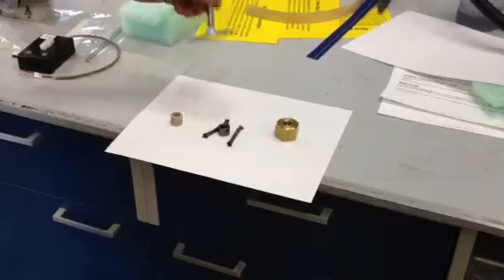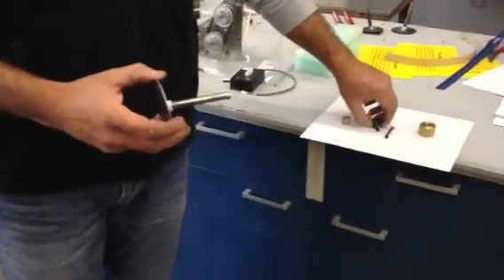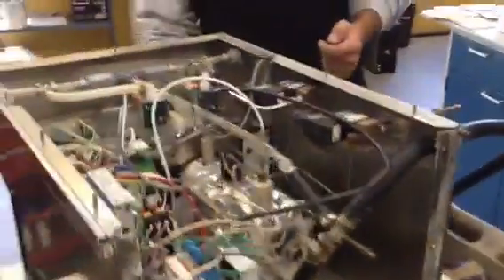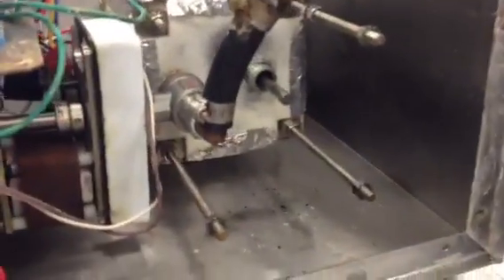So we're going to replace the packing, put the new packing in now. Show you a couple different ways that we could do it. The first thing you want to do is back to the front of the machine, slide the agitator down into the agitator nipple, and you'll see the agitator now protrude through the vessel.